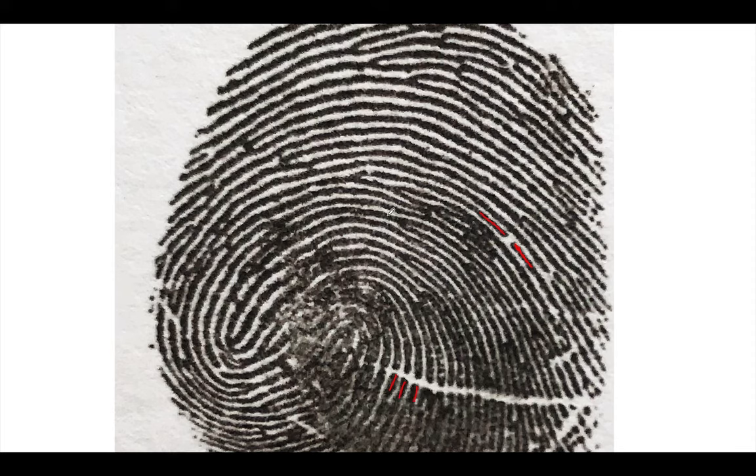I also see bifurcation. You see? Here's a bifurcation. Bifurcation. I also see double bifurcations. Check this out. Here's a bifurcation, and a little bit down the road, you have another fork, a second fork in the road. There's a double bifurcation. Your eyes start to bug out after a while.